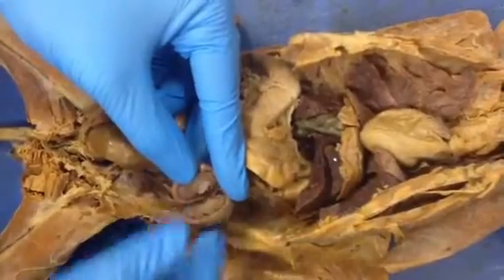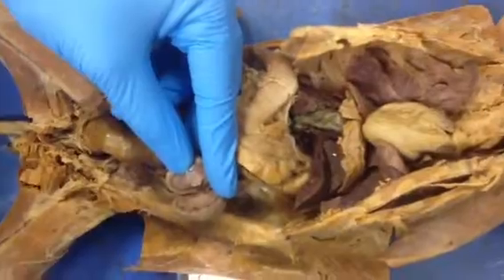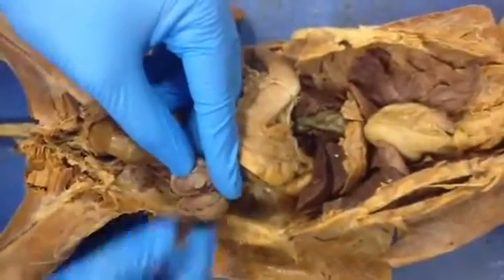What's the flap called? That's just where you cut the tissue in half. You created the flap by cutting it. John's flap.